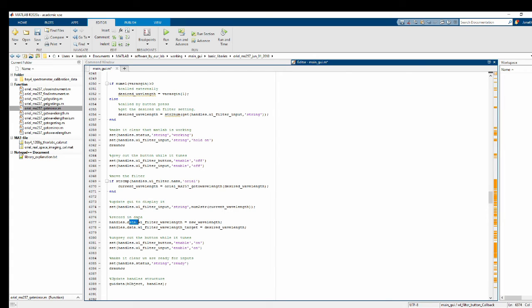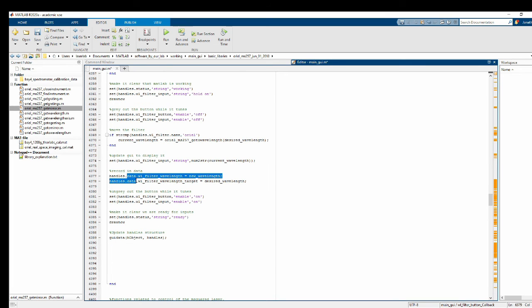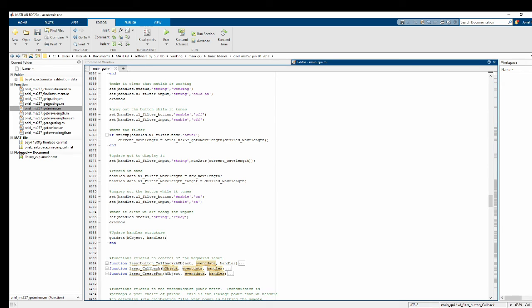And then inside of the data structure, we actually want to record two things. We want to record what the actual wavelength is and what we tried to put it to. Because normally if you tell it, hey, go to 650 nanometers, it's actually going to go to something more like 649.98 or something like that. And so if you want to reproduce, for example, when you're taking reflectivity, the exact settings you use to take another set of images, you need to record what you were trying to hit and also what you actually hit. Then once you record those two things, you ungray out the button, say we're done working, and update the handle structure. Okay, looks good.